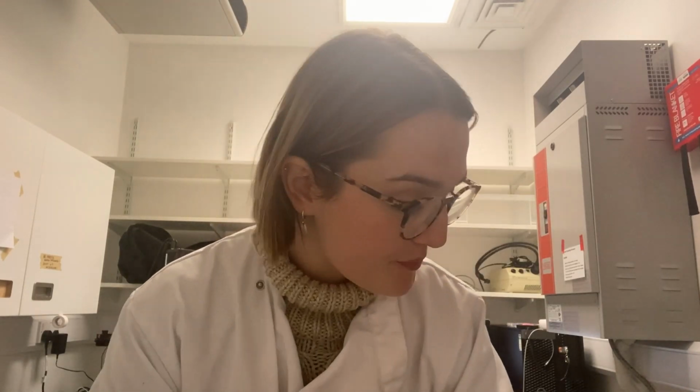The microscope has officially broken me. Turns out the microscope is the wrong microscope for the flow system that we have, so they will not be compatible. We need it in an inverted microscope where the focal point looks upwards. Instead, we have a top-down microscope.